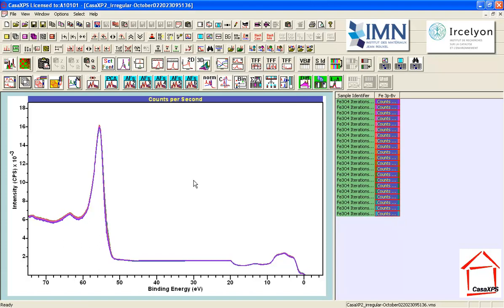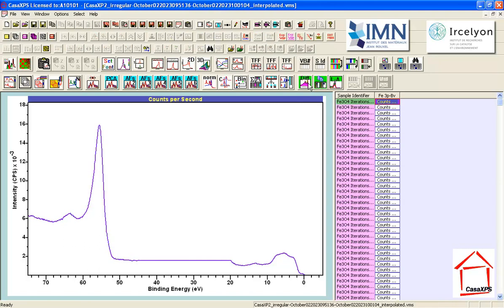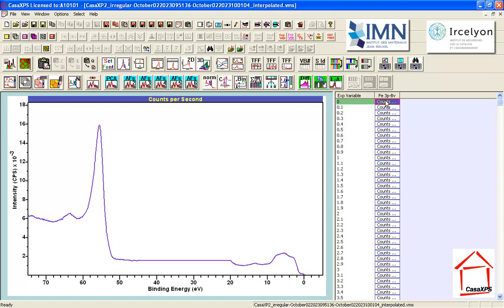Now I've got all of these overlaid in the active tile. This difference button will act on the first and the last as selected when overlaid in this active tile. So when I press the difference, it will be the difference between the first and the last in this list. And the result of that is a list of spectra that are all slightly different, in as much as each spectrum represents a slightly different proportion of the first spectrum subtracted from the last spectrum, or vice versa. And it depends on which end of this list, which spectrum is the most significant in this difference relationship.